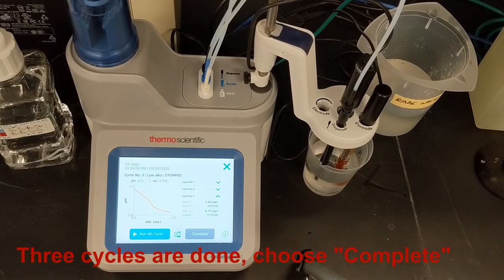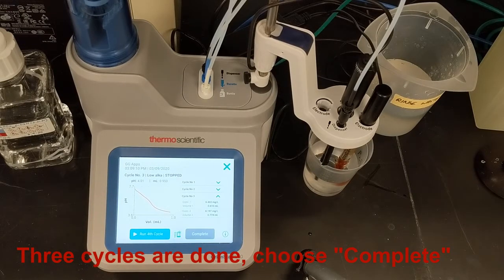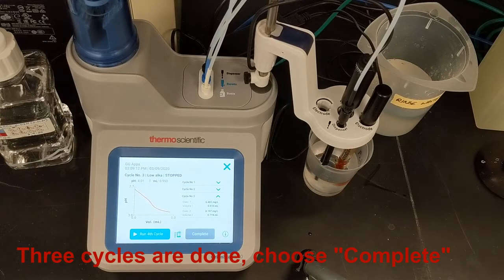When the three cycles are done, I will choose Complete to end the titration and see the results summary.